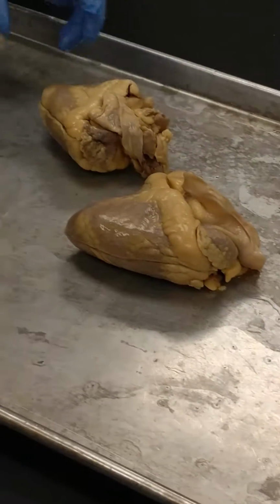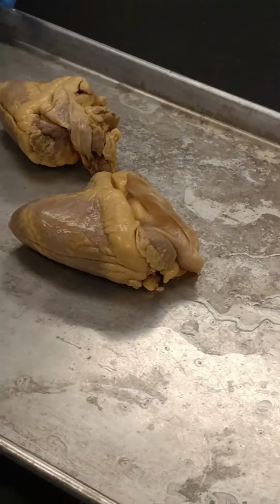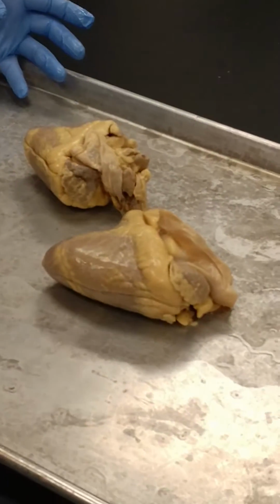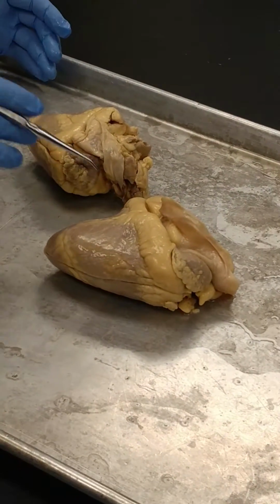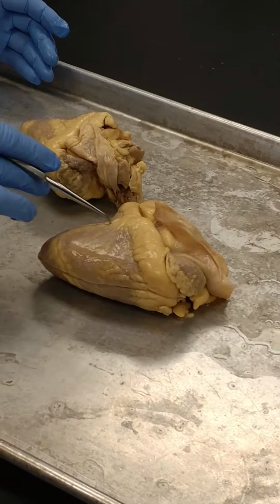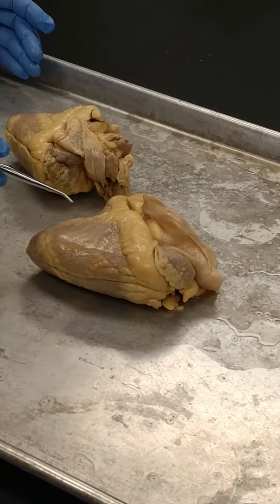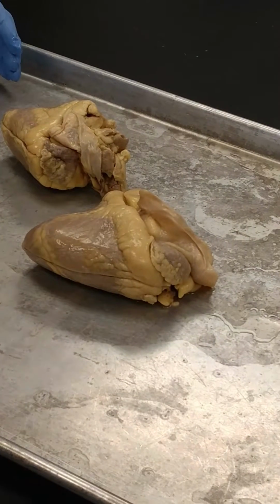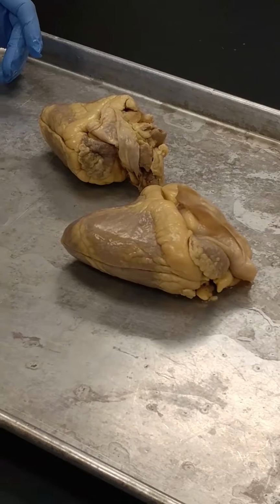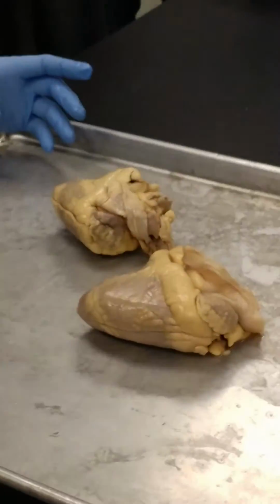And everybody always asks, why is that? Because it doesn't make sense that you would have a lot of fat with these vessels, because isn't fat what helps to clog these vessels to create coronary artery disease? And the answer is yes. So there's a dichotomy here, a catch-22. Fat has a tendency to collect in these vessels because it's adjacent to the vessels. But then the question is, why is the fat there? Anybody have an idea? Stability? No, good guess though. A lot of people think protection.